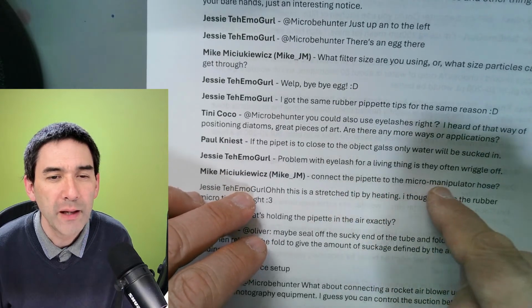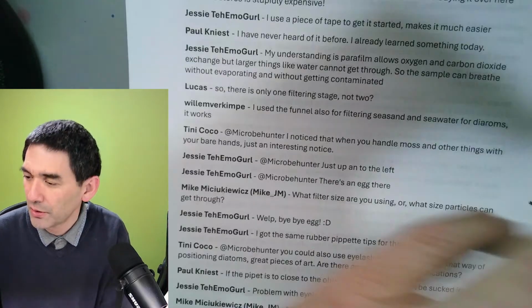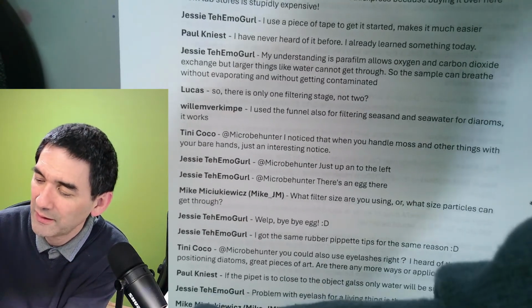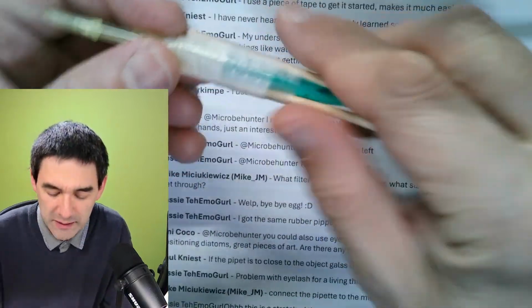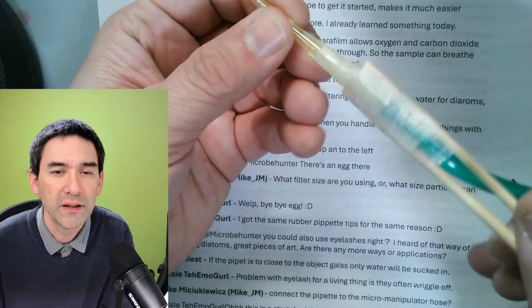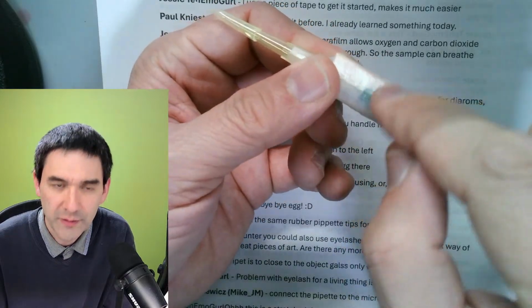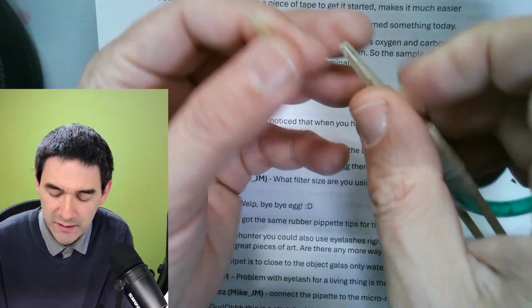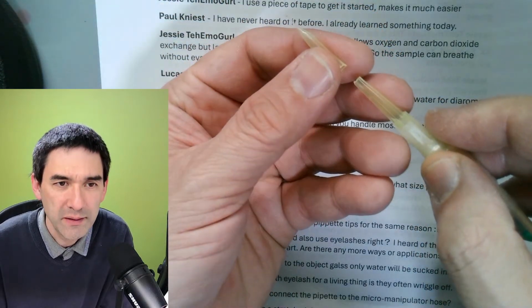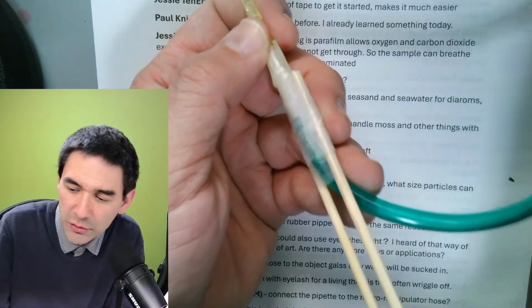Connect the pipette to the micromanipulator hose. Yes, this is what I have done. Okay, you know what I'm going to do? Because I've already demonstrated it to you, I'm just going to show you how I made that. So this is basically how it looks. This is how I clamped it to the stand. Over here, this is parafilm. This is a pipette tip that I cut off, and this is the small pipette that I made using the fire. And here I simply connected the tube with a pipette.